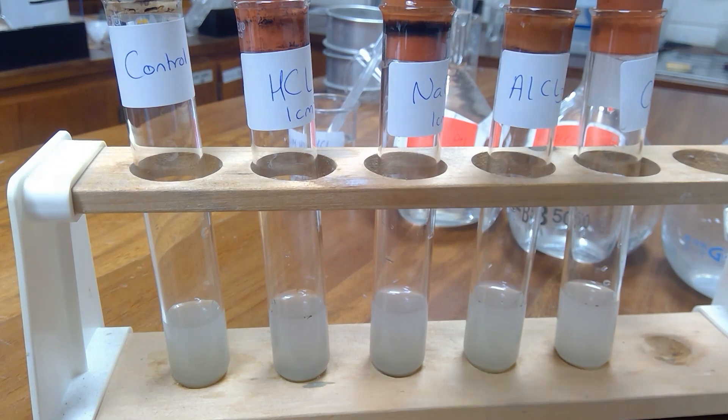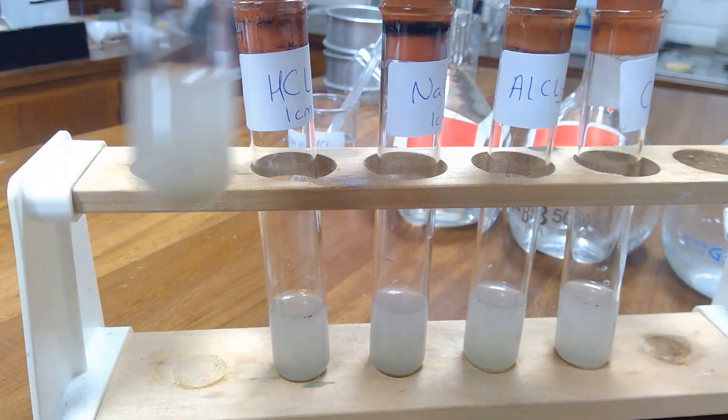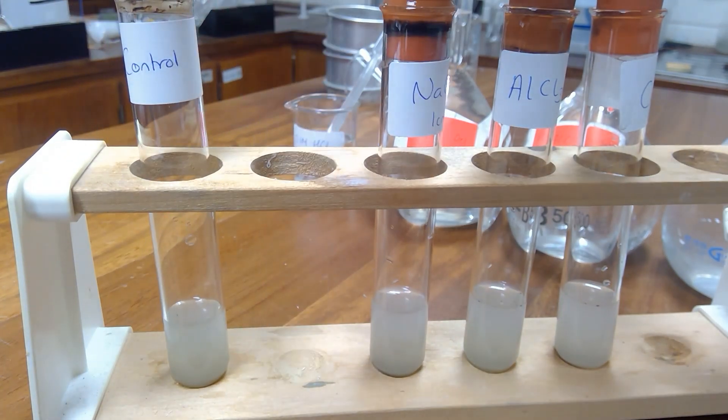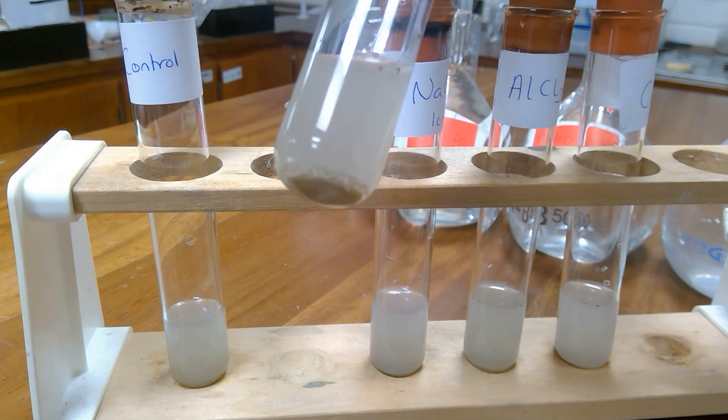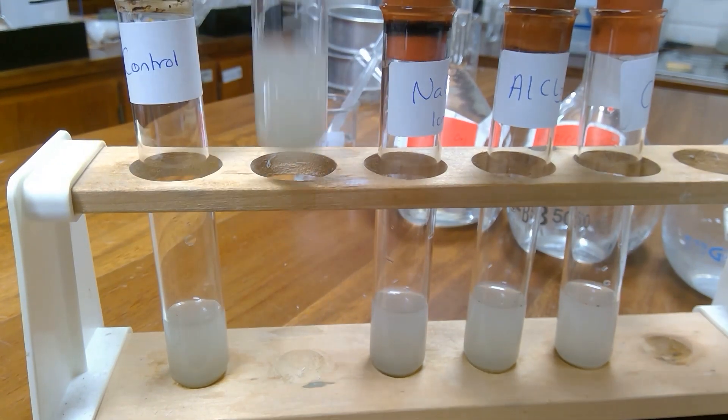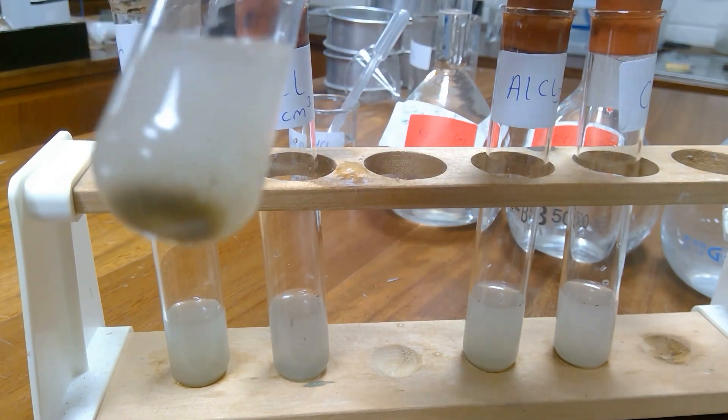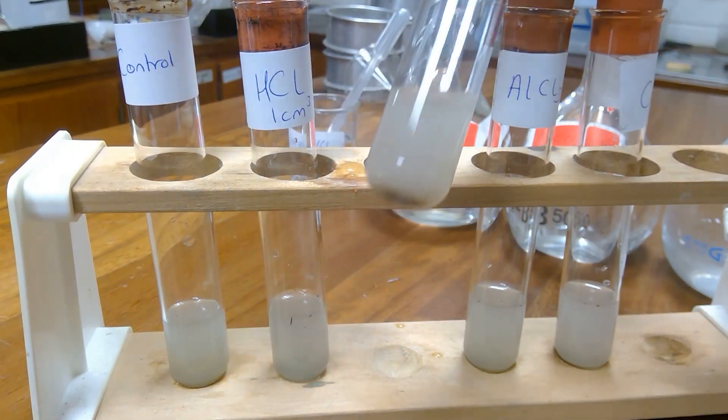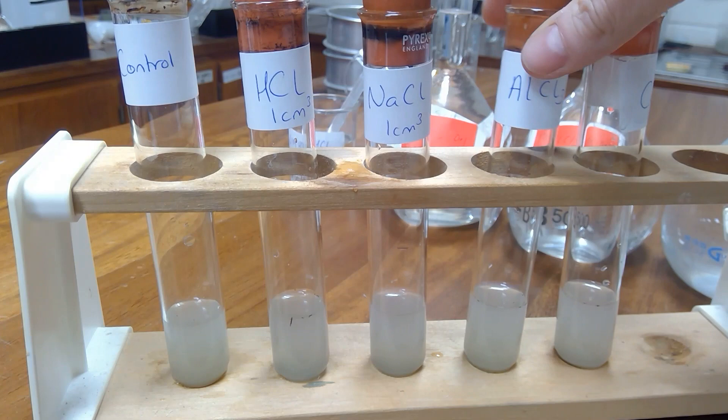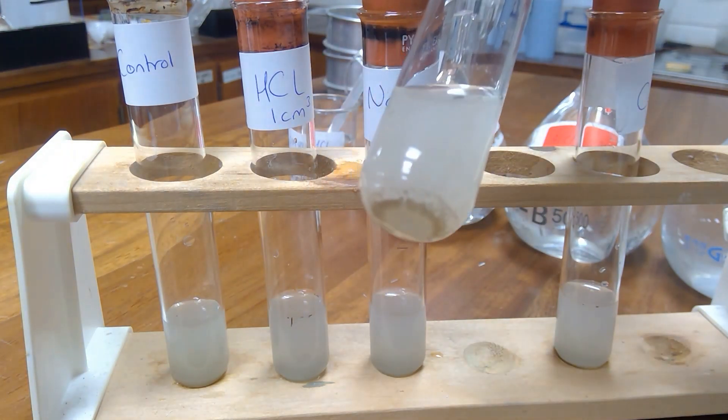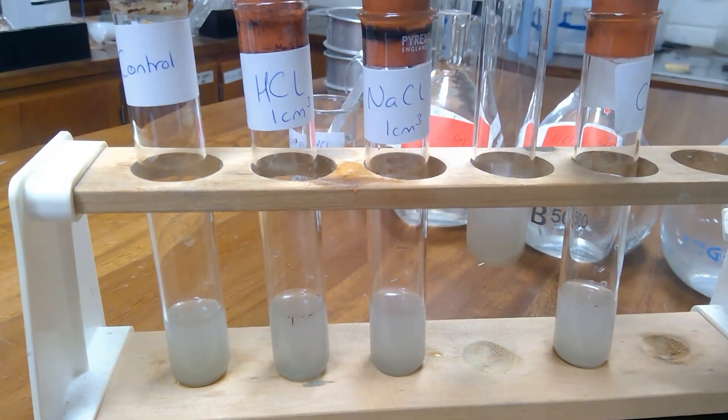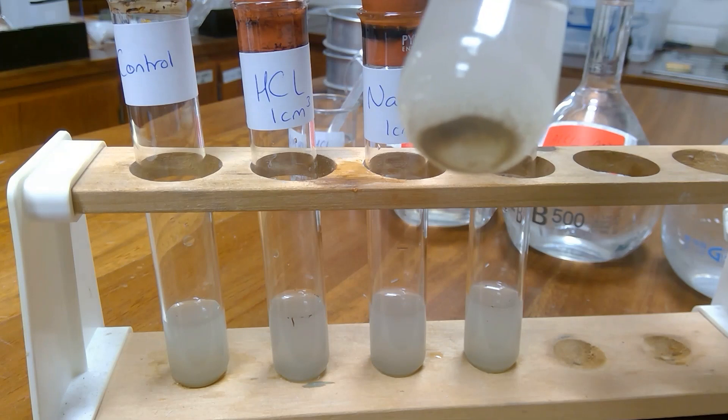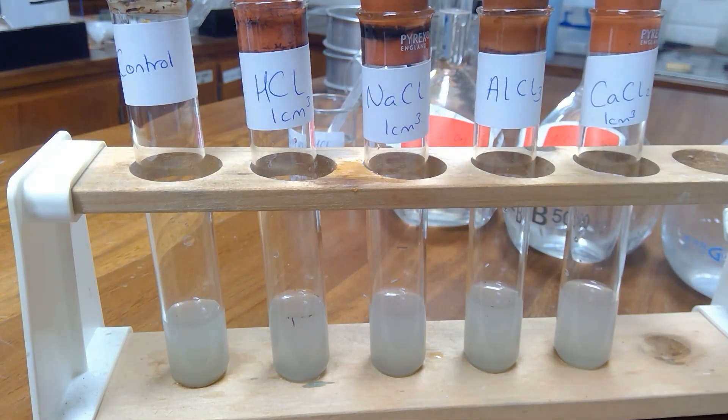So, after the first five minutes you can see the control has settled a good bit, the hydrochloric acid on par with the control if not a wee bit clearer, the sodium chloride, the aluminium chloride is not working at all and the calcium chloride and we'll leave it for another five minutes.